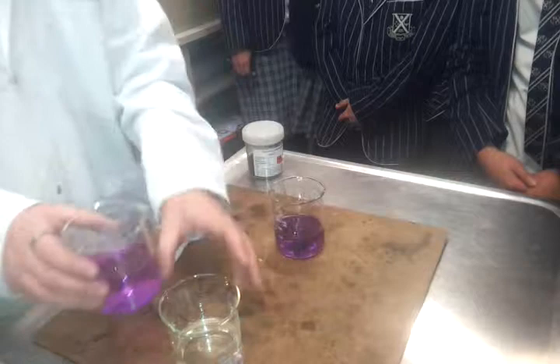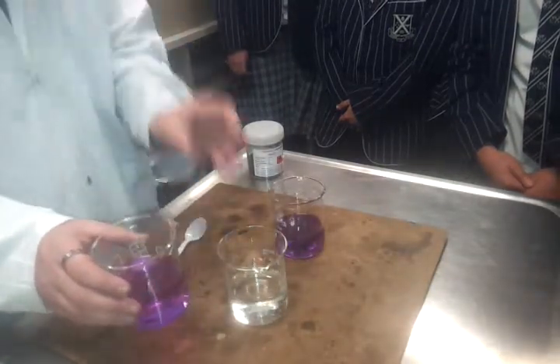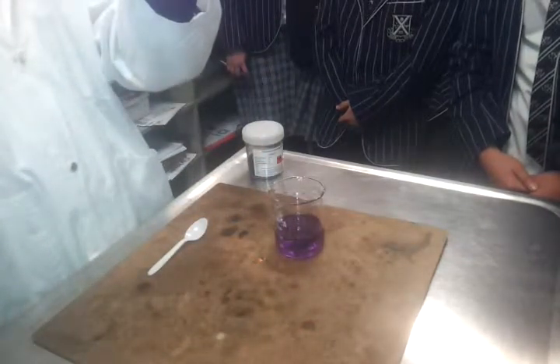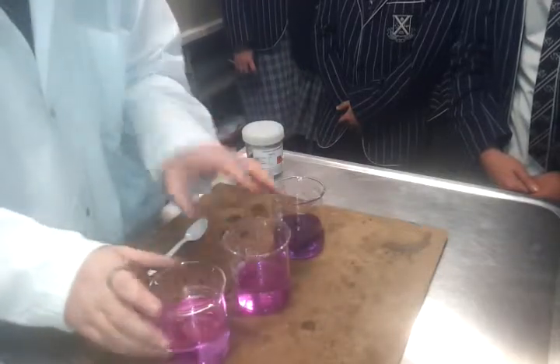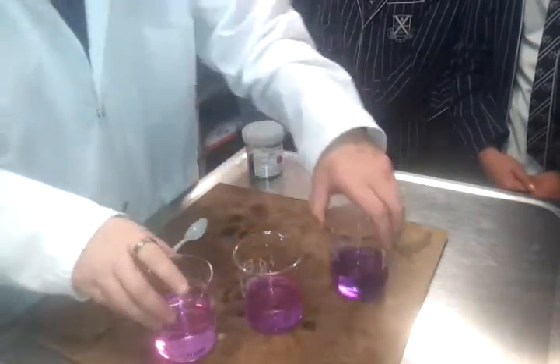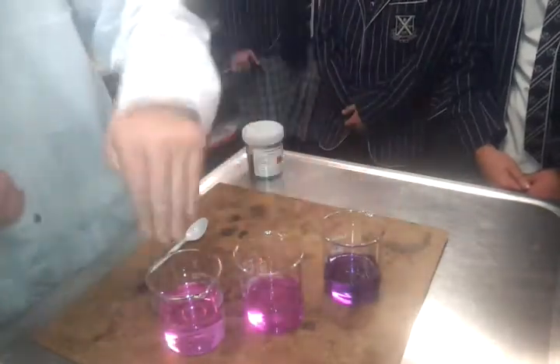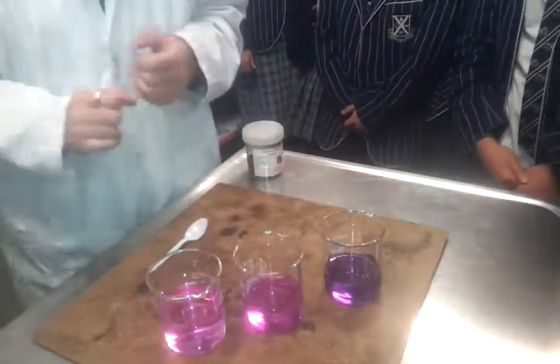So what do we predict is going to happen if I put 50 mils of this into here? It'll go even lighter? Let's see if we're right. Oh yes, lots lighter, isn't it? So again, it's only 3 times more dilute. And I'm sorry, I'm going to put them this way here so the camera hopefully can see all those. Yep. And we can see that we've got a dilution series. And we can say it's a dilution series just by looking at it because it gets lighter and lighter.